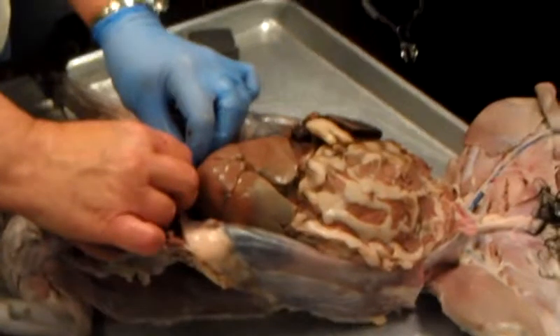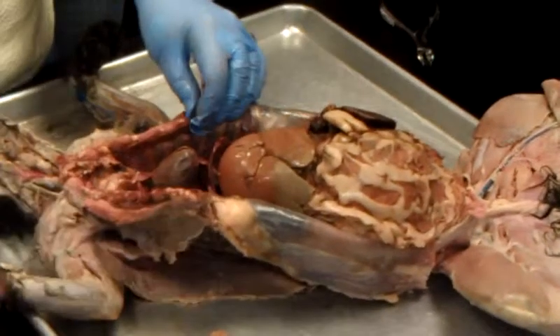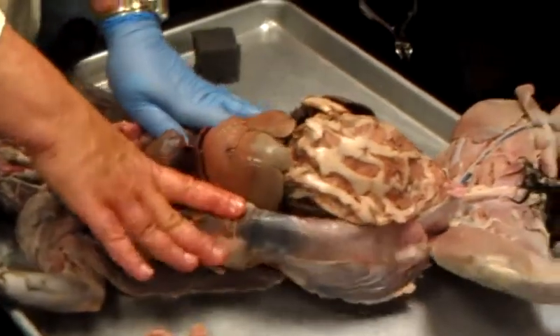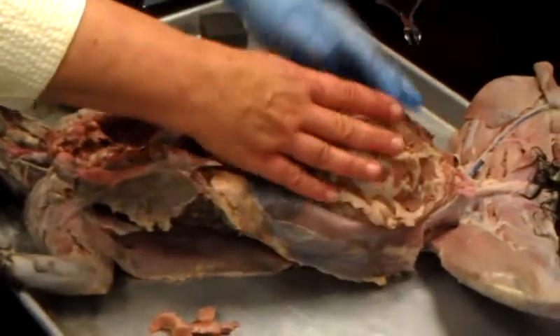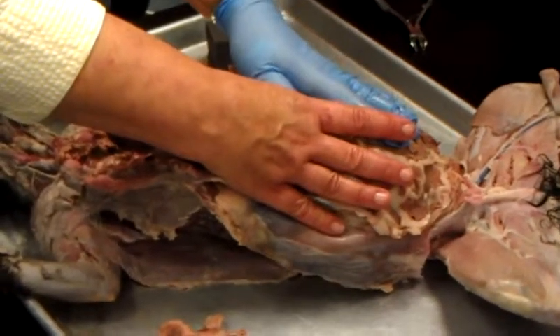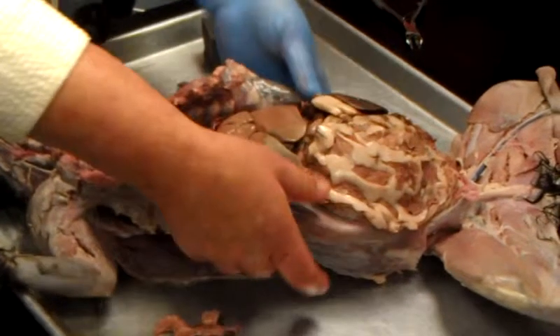Okay, then you have your diaphragm. The left's all one, but the right's two? Yes. Interesting. Now, here's your diaphragm. Let's just do membranes down here. Down here we have the abdominal pelvic cavity. The membrane's the peritoneum, right?